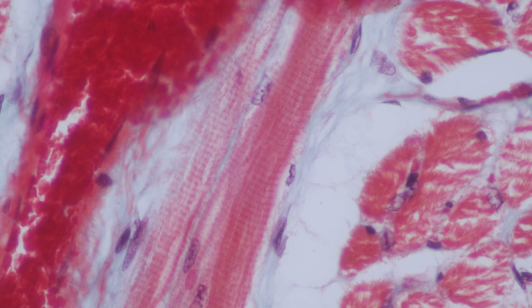So we're just going to look at this one muscle type. God, I remember looking at this when I was at university. We will talk about the myofibrils and see what they look like. We'll look at the connective tissue if we can find some, to see how it's all joined together. We'll talk about the sarcomeres, what gives that stripy appearance. But yeah, let's have a look at some skeletal muscle, shall we?